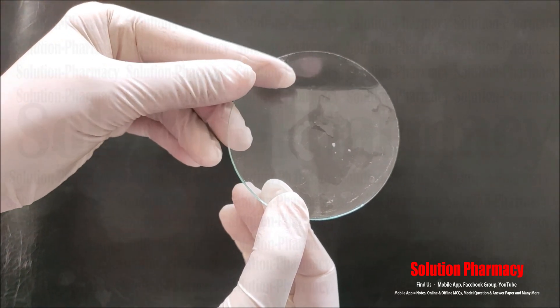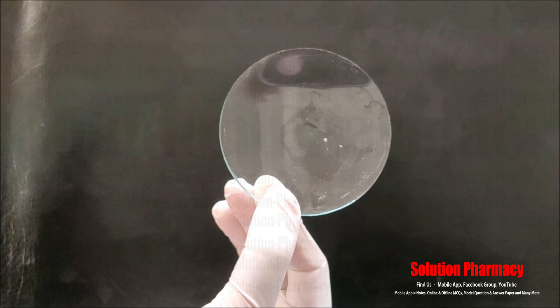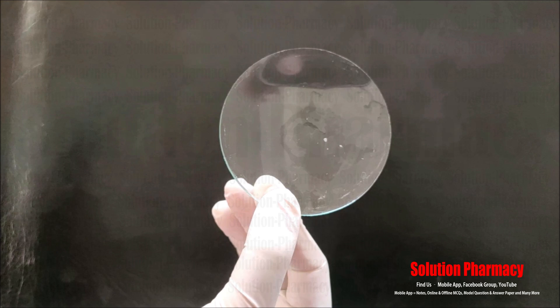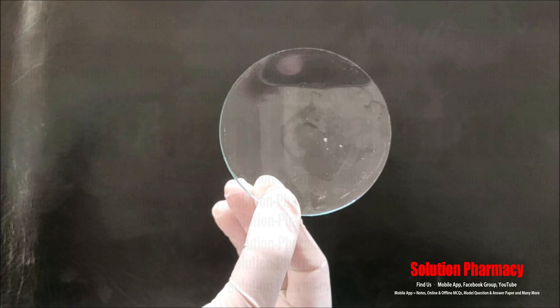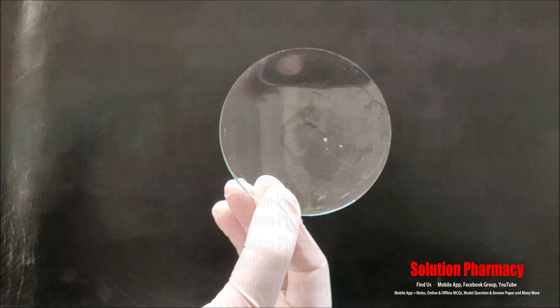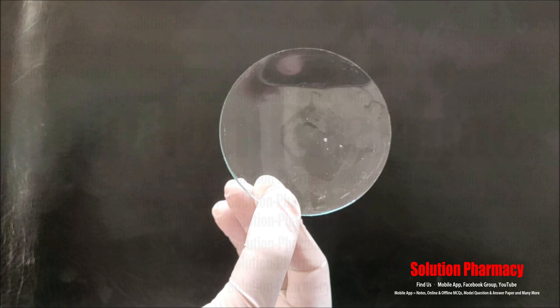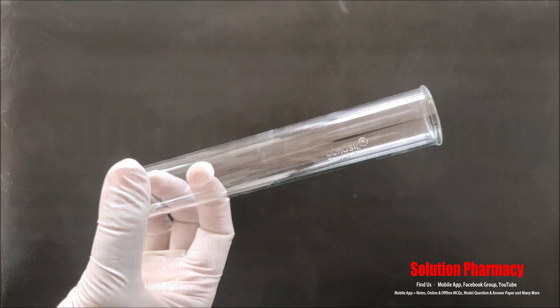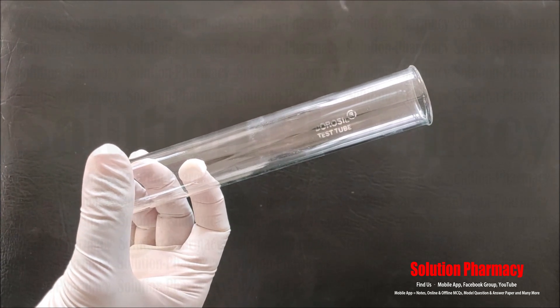Next, this is called a watch glass. As you can see, this is a circular concave piece of glass. It is used as a surface to evaporate a liquid, or to hold a solid while being weighed — we place the watch glass on the weighing machine, tare it to zero, then place the sample on it. It is also used for heating a small amount of substance, as a cover for a beaker to prevent dust from entering, and to hold water and staining reagent during slide preparation.